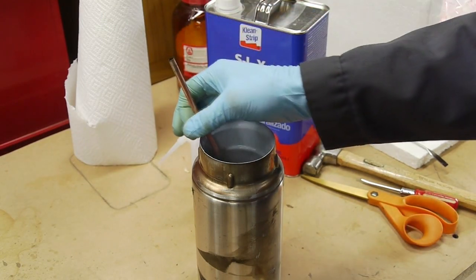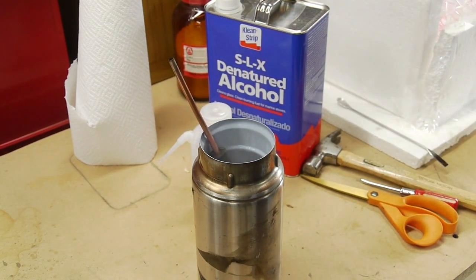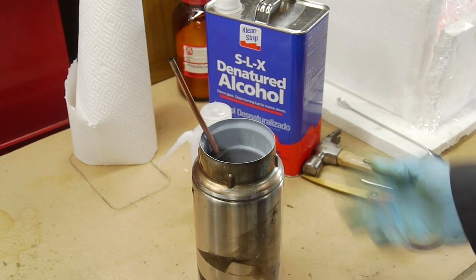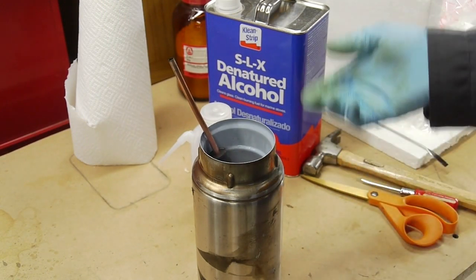And in the matter of a few minutes, the anhydrous ammonia had turned into sort of like a crystalline solid. I'm not really sure what happened. It may have reacted with water vapor in the air or CO2 coming off the dry ice or something, but that didn't work too well.